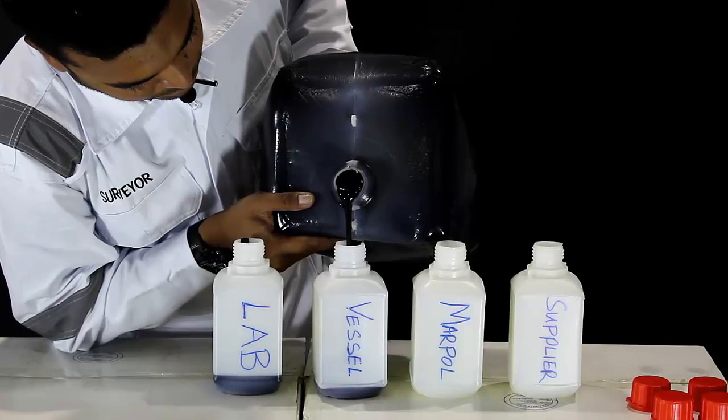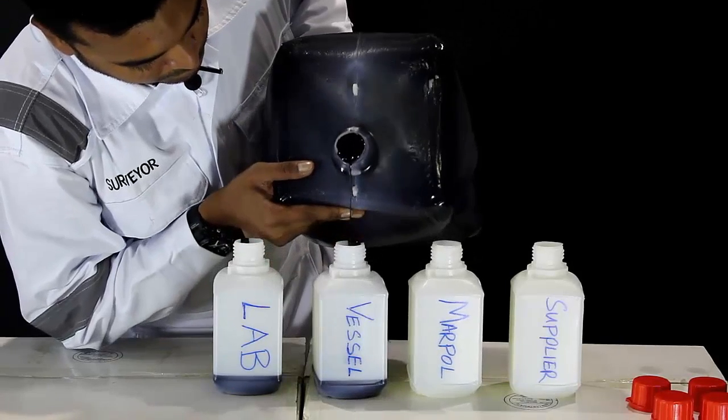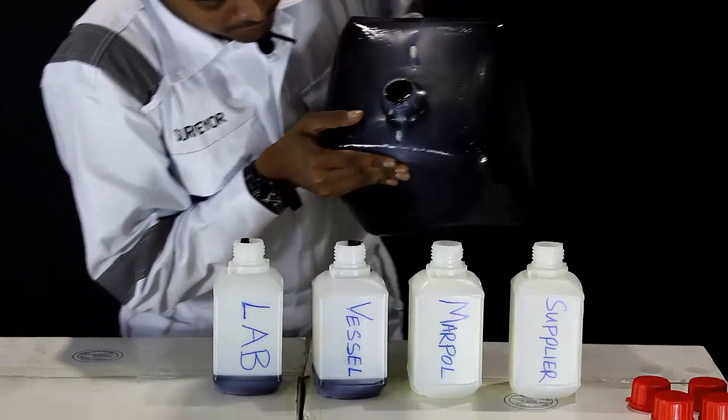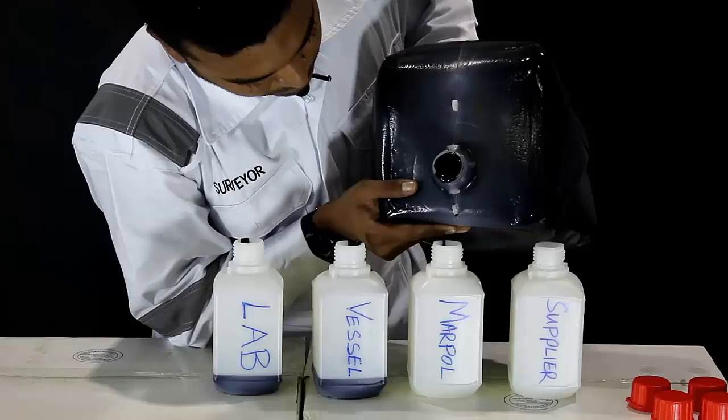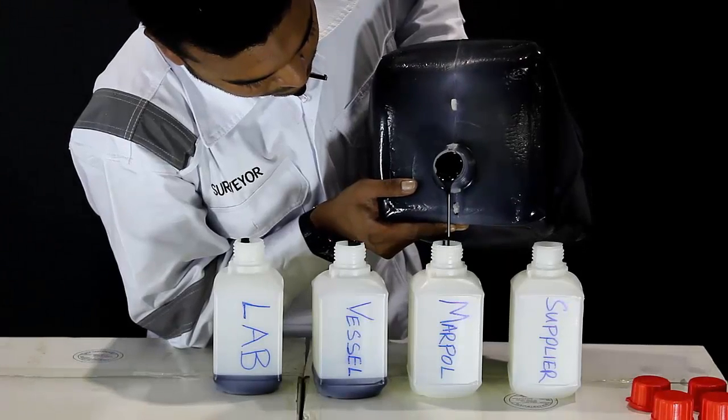One sample bottle is intended for the testing lab, one bottle for the supplier, and two bottles are to be kept onboard the vessel. One of these bottles is for the Marpol regulatory sample.